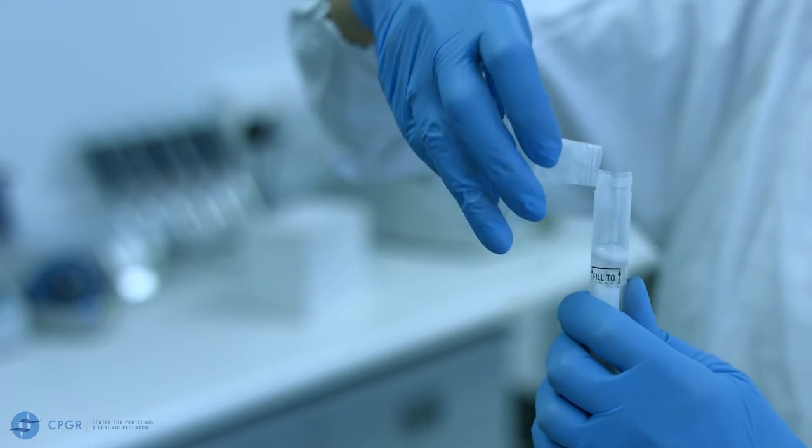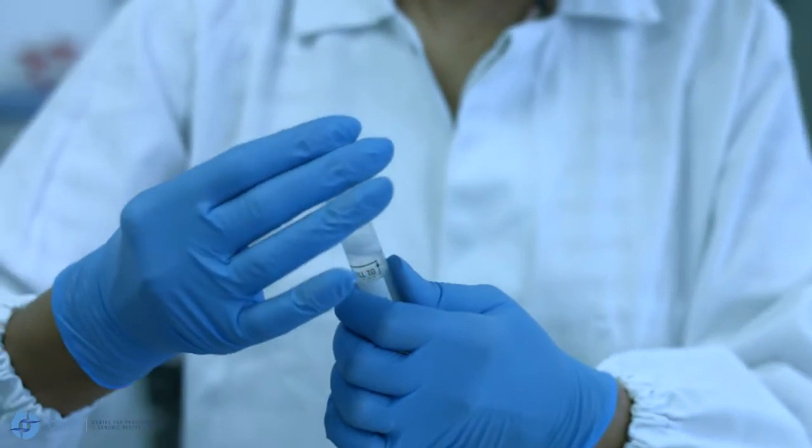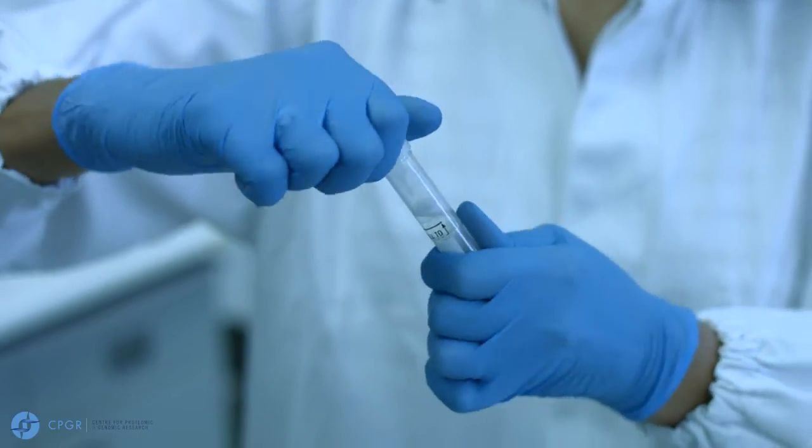Unscrew the lower tube and close with the cap provided. Mix by inverting several times.